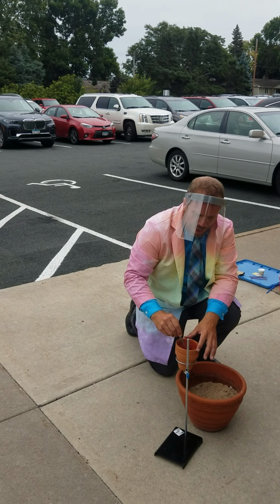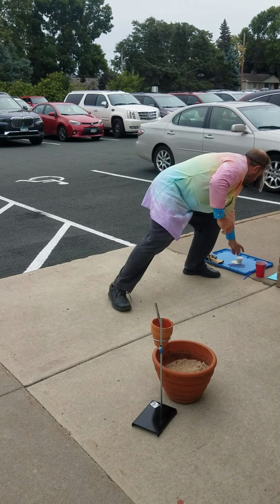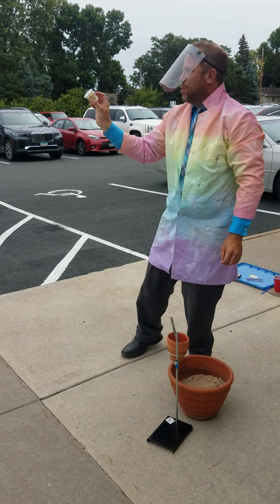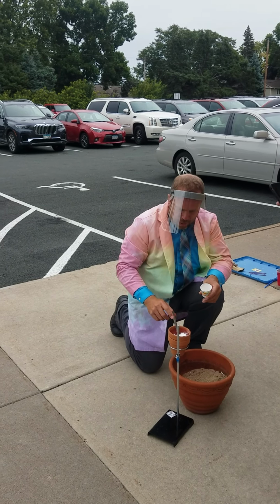And we're going to use fire to get it going. And to help it along the way, I borrowed a little bit of a thing called solid rocket fuel. They used this in the space shuttle years ago when they launched rockets. So we're going to use a little bit of that too.